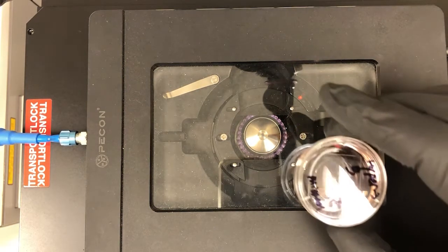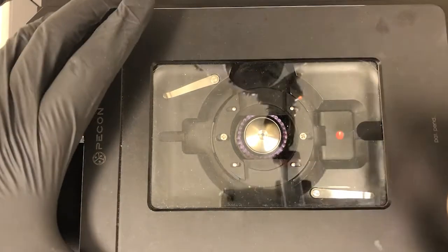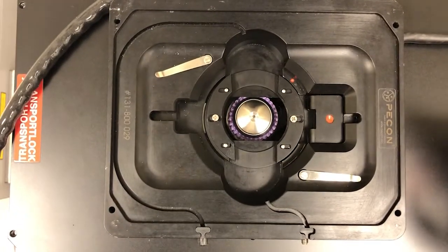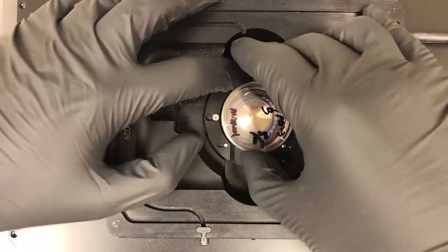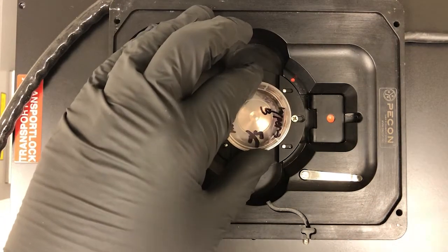So I have here a 35 millimeter dish. I'm going to remove the lid. I usually place it on this part of the microscope, just for convenience. And then I can place the 35 millimeter dish in position here. You can see this particular dish fits quite snugly.